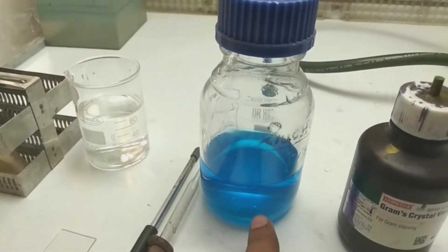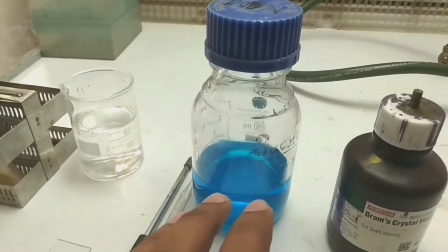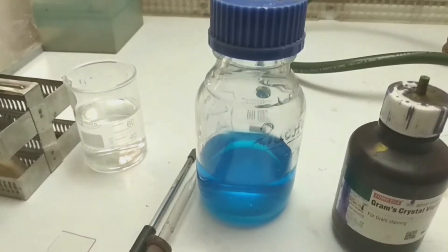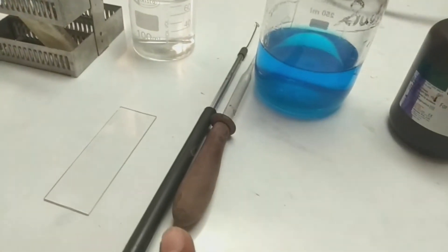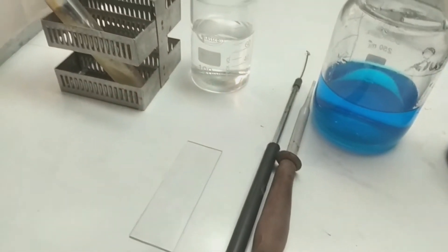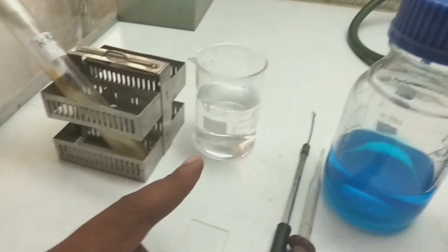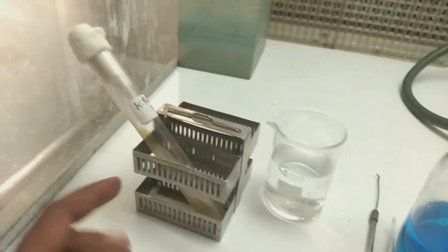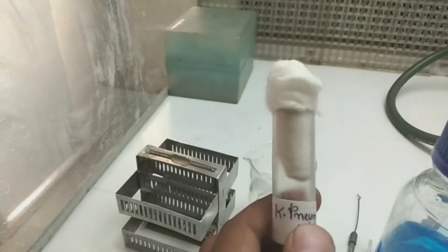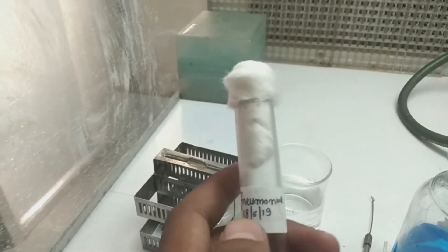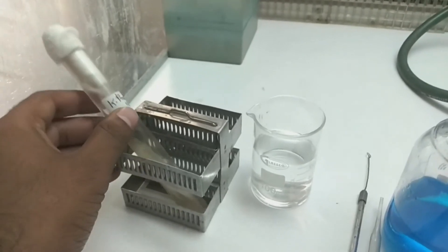20% copper sulfate for decolorizing purpose - it is a mixture of copper sulfate and distilled water - and a dropper for decolorizing, inoculum loop, a grease-free slide, a distilled water beaker, a slide rack, and the most important thing: the Klebsiella pneumoniae culture which forms the capsule which we are going to stain and visualize under microscope.